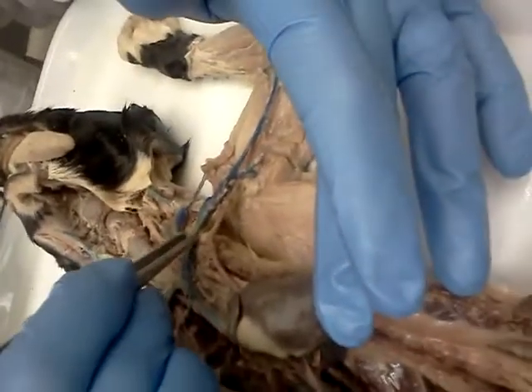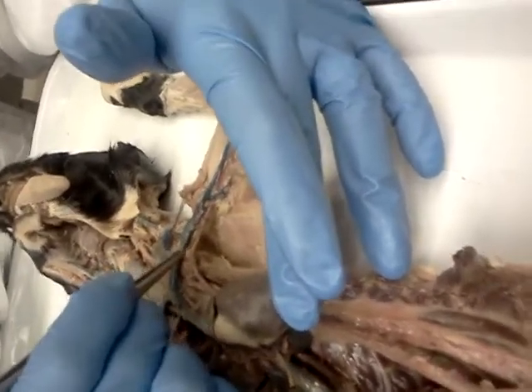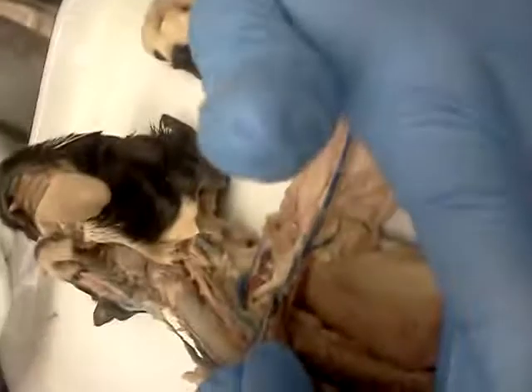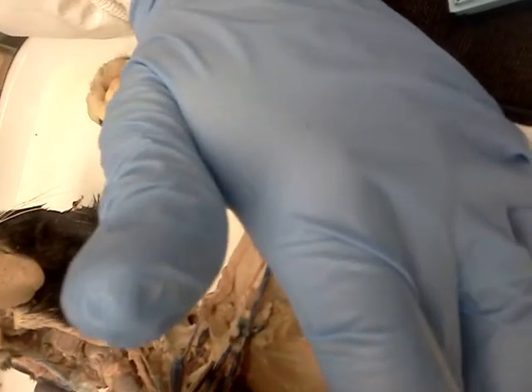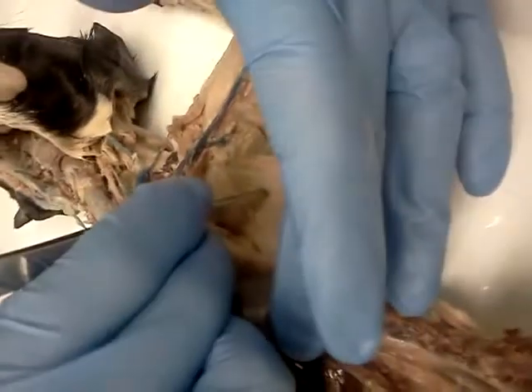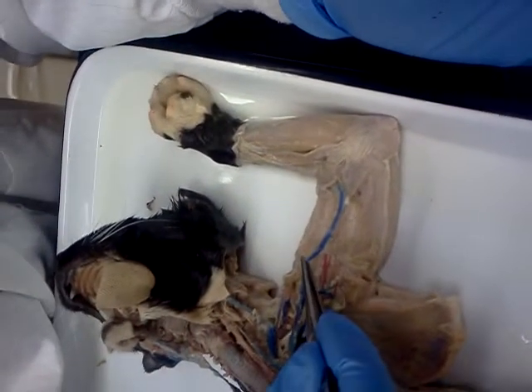Now, on the other side of the branch point that generates the jugular veins, you generate the subclavian, below the shoulder. And is that axillary coming up? At the other side of this branch point, you go into two primary veins. The first is the subscapular. Subscapular travels deep into the shoulder. On the other branch of this would be the axillary. That's from this branch point to this branch point. That's your axillary. On the other side of this branch point, here, you have the brachial.